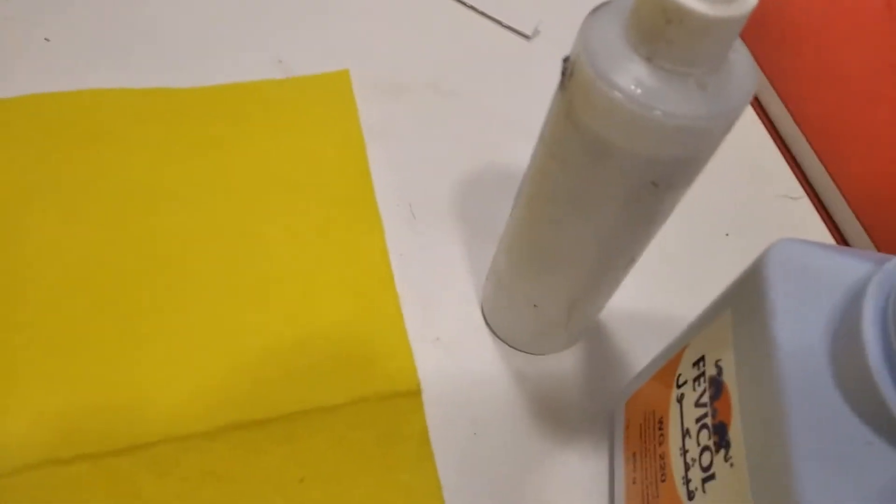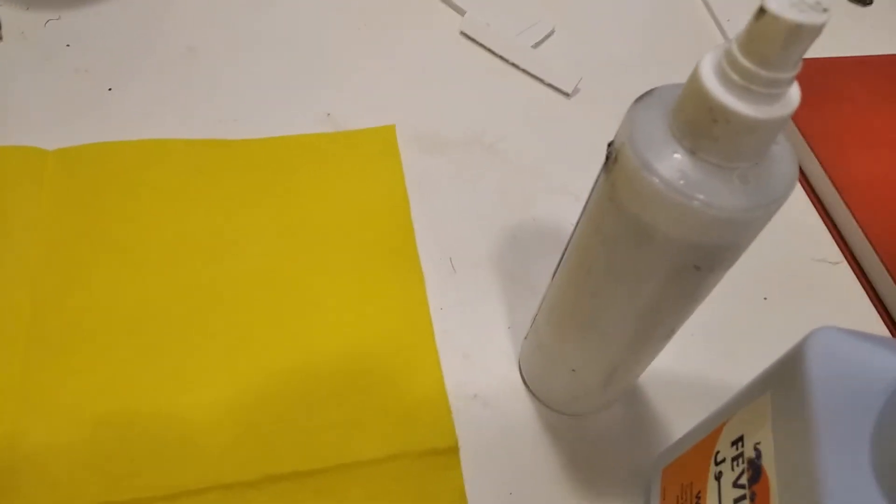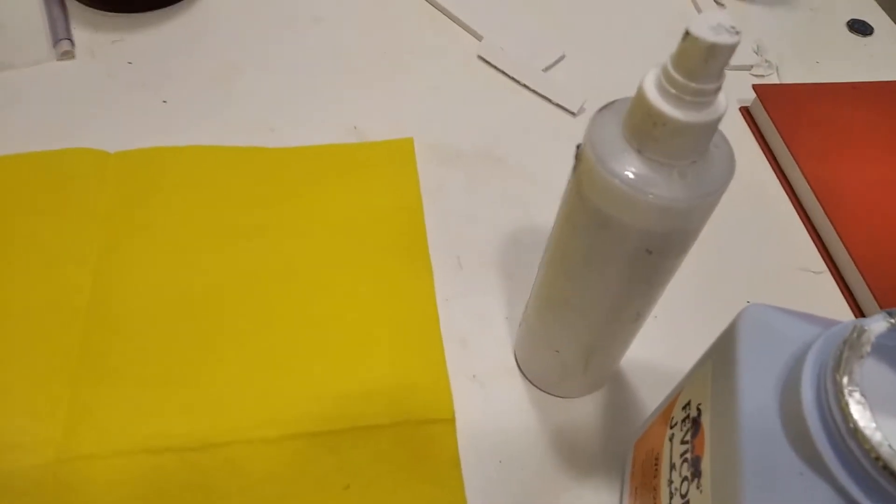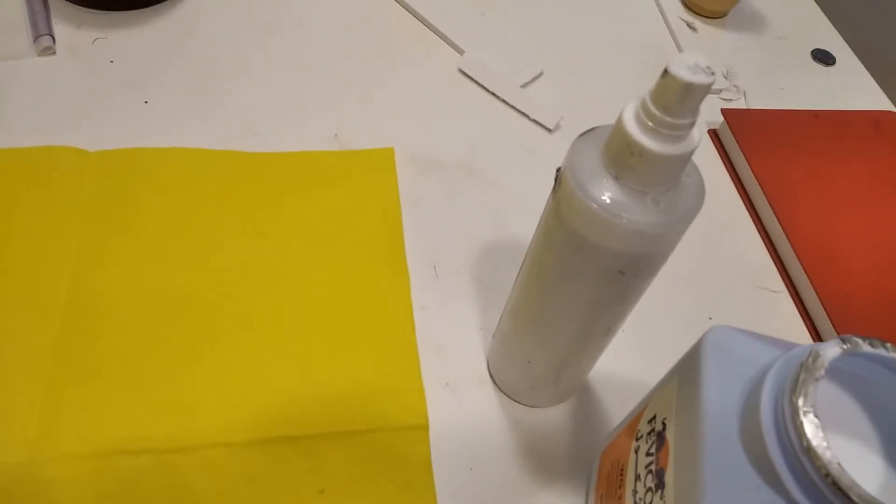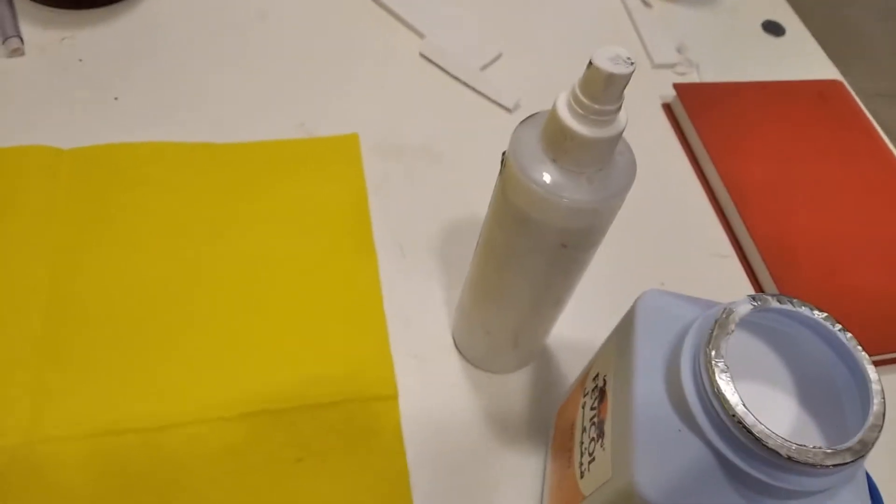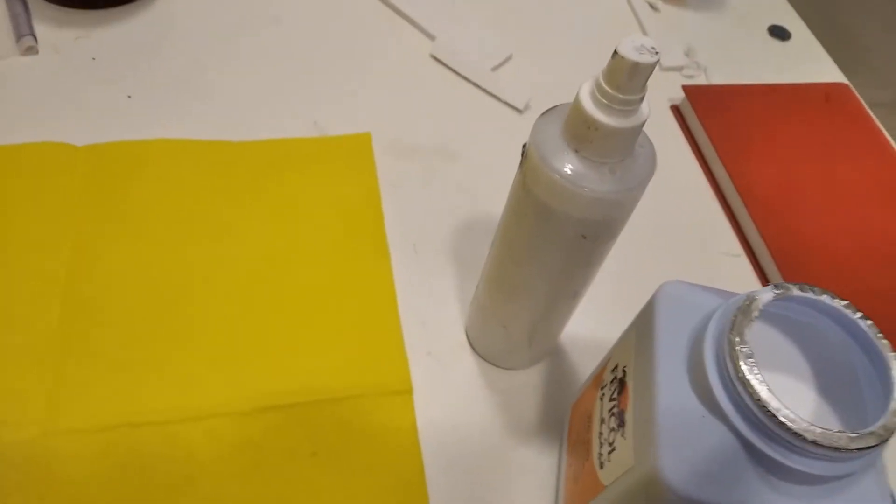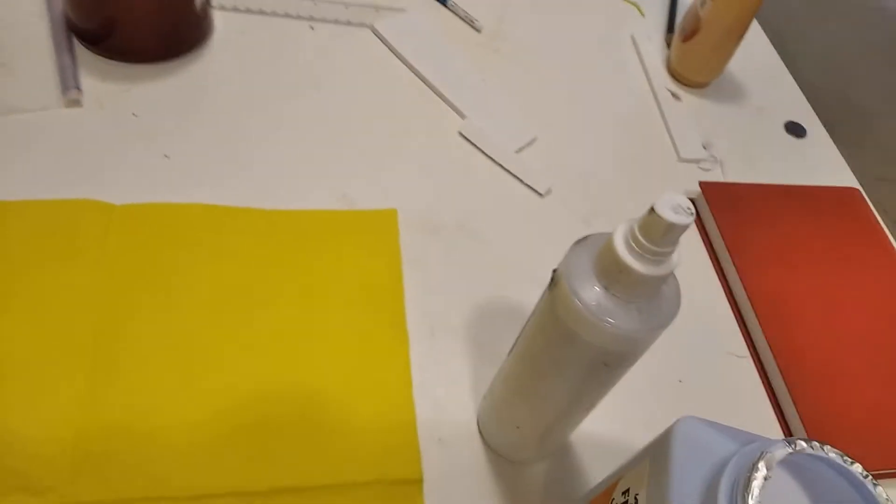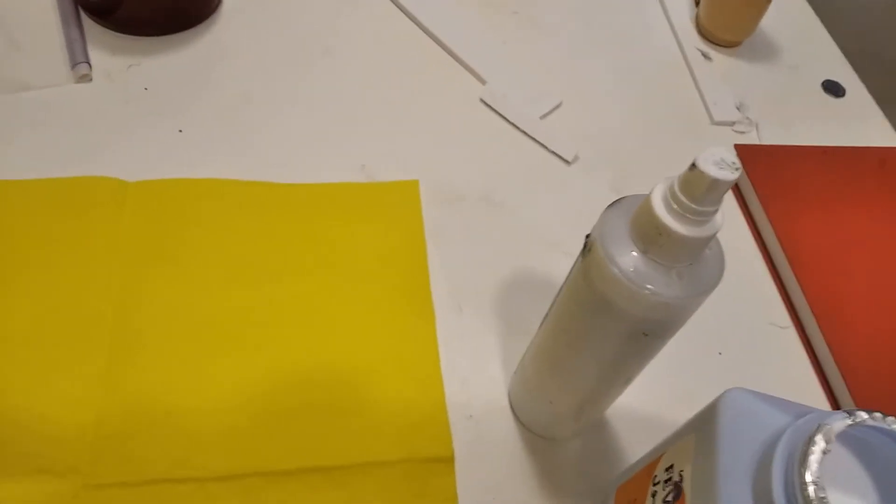Sodium borate because this will be used for sodium ions. If you need potassium ions, you use potassium borate. If you need calcium ions, you use calcium borate. You just mix boric acid with whatever ion you want, or you can even apply hot boric acid solution onto this.